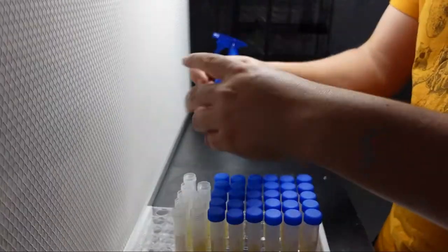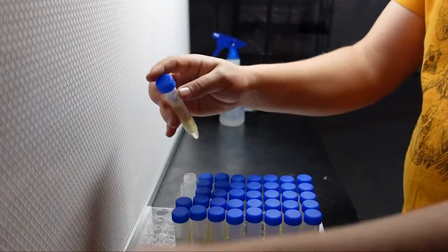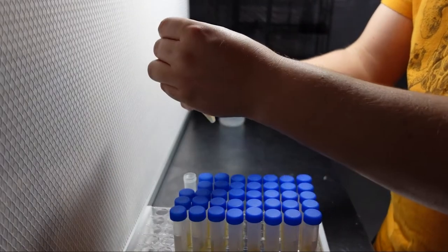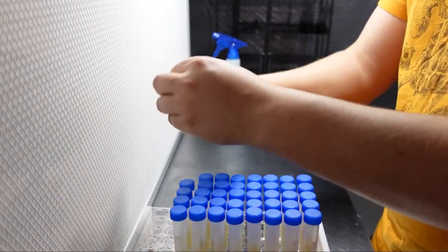Once all of your tubes are loosely capped, place them in your pressure cooker or autoclave and sterilize them for 20 minutes at 15 psi.